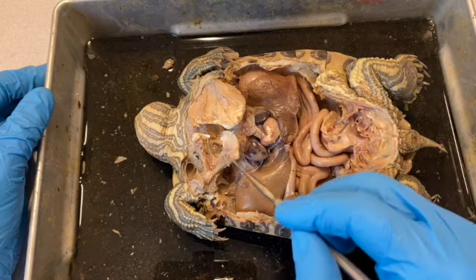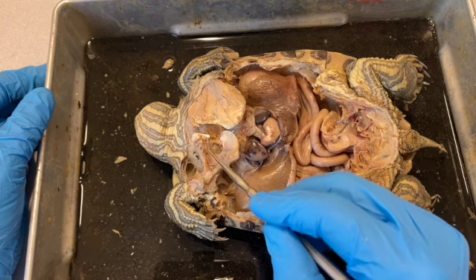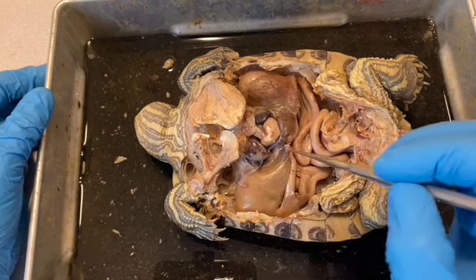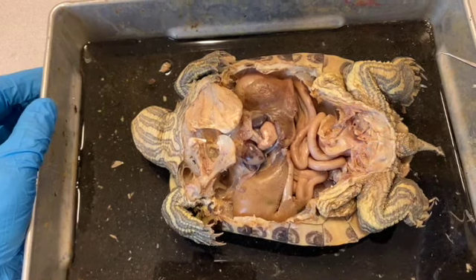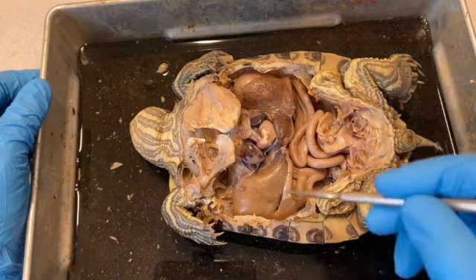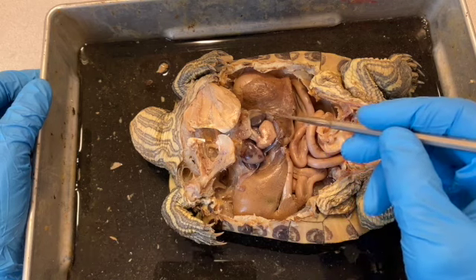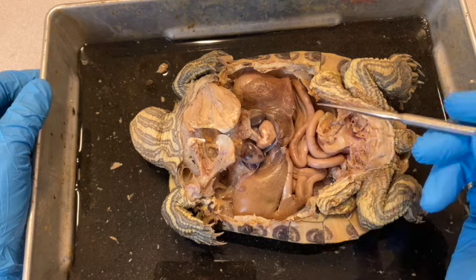This bone right here is the coracoid, and this one is the precoracoid. Now, there's another bone that extends dorsally that you can't see in this preparation, and that is the scapula. So if we take a look at the soft tissue inside the abdominal cavity, the abdominal cavity has been opened up, as has the pericardial cavity.